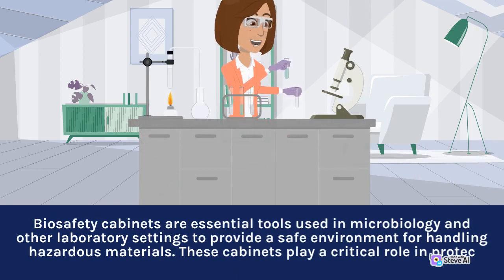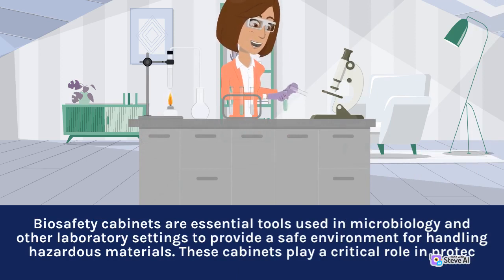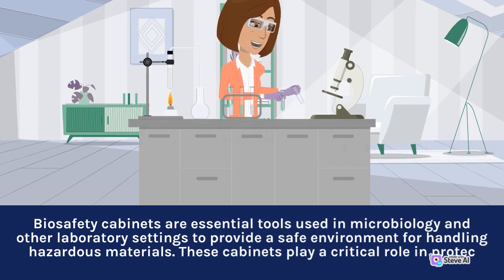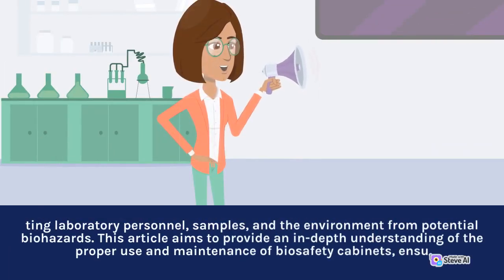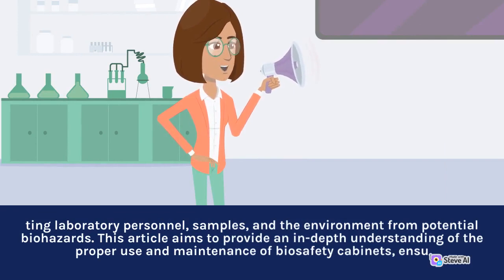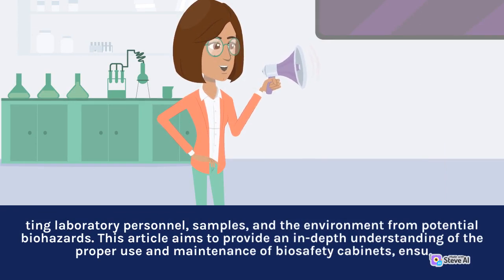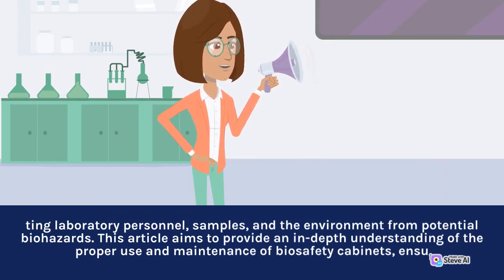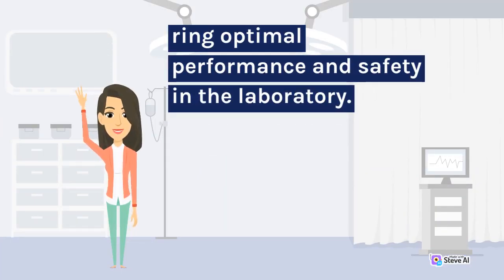Biosafety cabinets are essential tools used in microbiology and other laboratory settings to provide a safe environment for handling hazardous materials. These cabinets play a critical role in protecting laboratory personnel, samples, and the environment from potential biohazards. This article aims to provide an in-depth understanding of the proper use and maintenance of biosafety cabinets, ensuring optimal performance and safety in the laboratory.